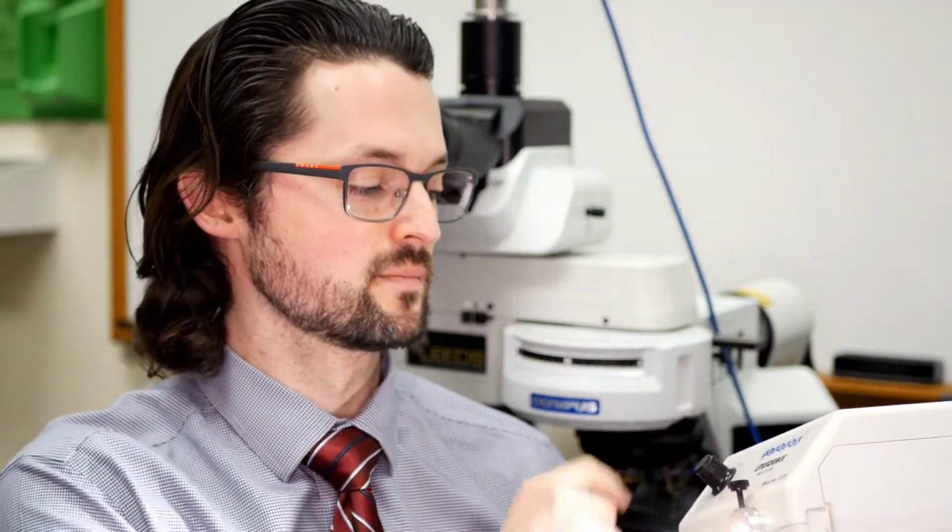So what you would invariably end up doing, if you wanted the best color rendering, which most trace examiners that I've worked with will really be focused on, is crank your light source all the way to the max, and then use a blue daylight filter, a little piece of blue glass that goes on the bottom of the microscope. But the problem is then your light, while it's very corrected and very good in color rendering, is just way too bright.